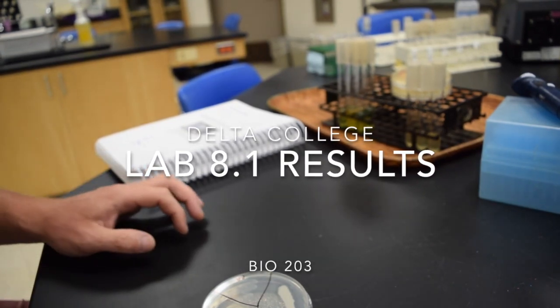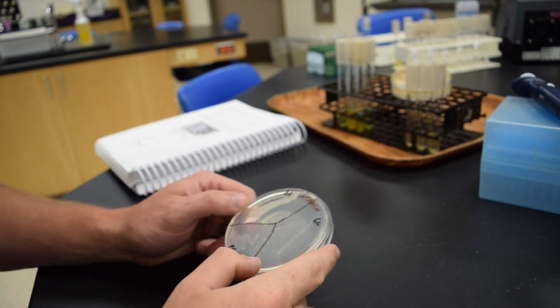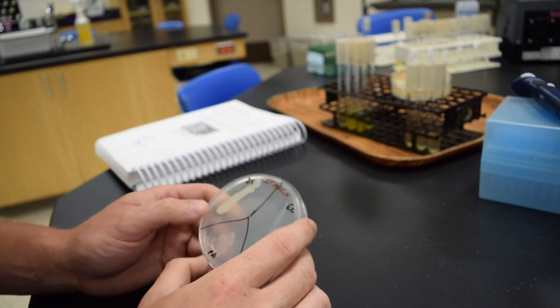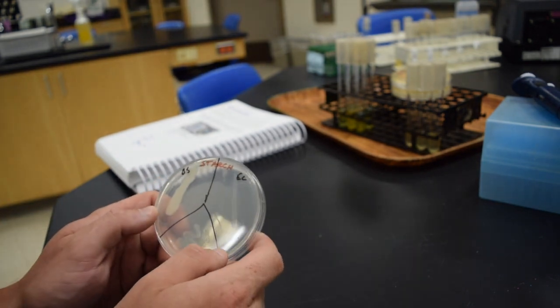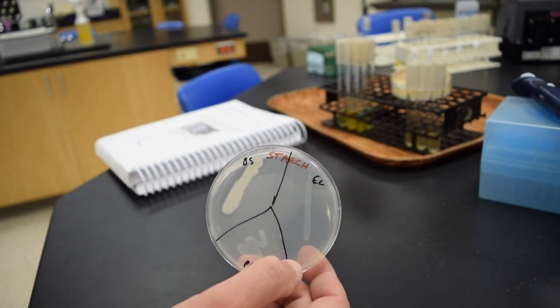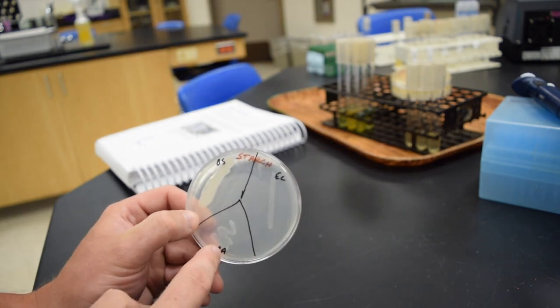All right, this is lab 8.1 analysis. I didn't show the inoculation of this. The other videos show how to inoculate the tubes and the media. So this here, part A of lab 8.1, is starch hydrolysis media. This is a starch plate, and here I have Bacillus subtilis, Escherichia coli, Pseudomonas aeruginosa.